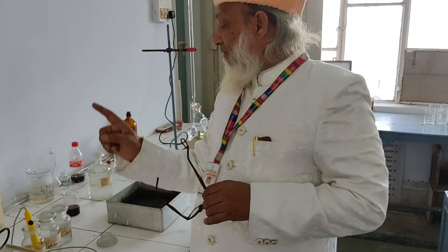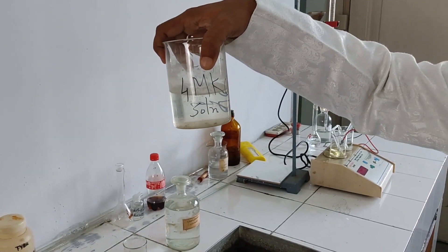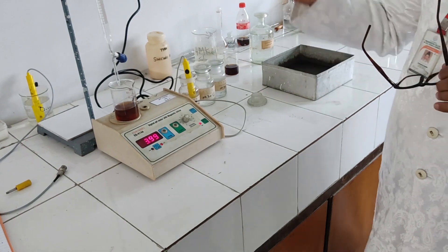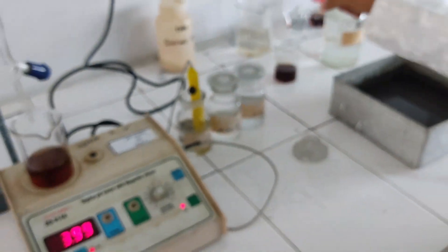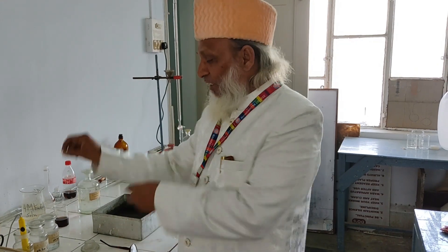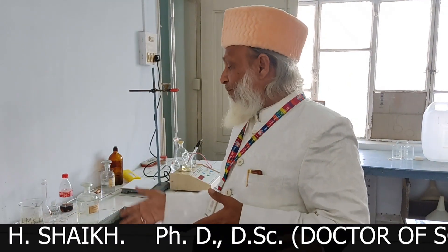Remember, this pH electrode has always to be put in 4 molar KCl solution or saturated KCl. This KCl provides chloride ion. If you keep this electrode in distilled water, the ions will be leached out from the glass membrane and it will become useless. Therefore, it has always to be put in 4 molar KCl or saturated KCl. This electrode is like a fish — without water, fish cannot survive. So this electrode without 4 molar KCl cannot work and cannot survive.